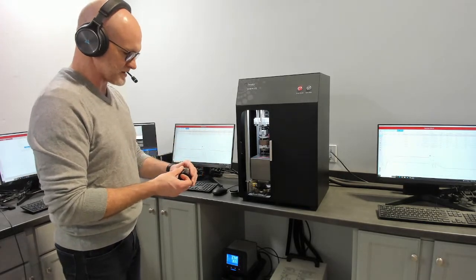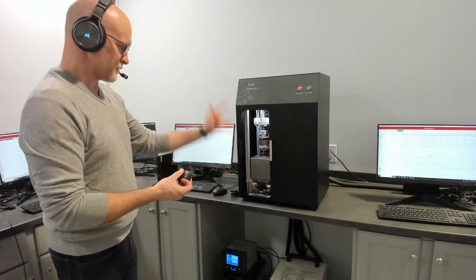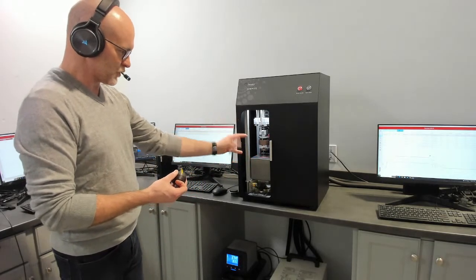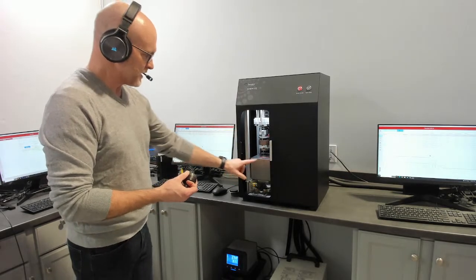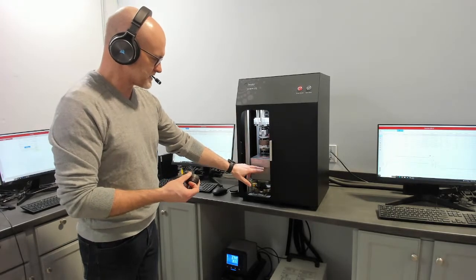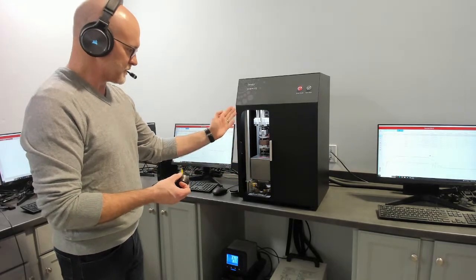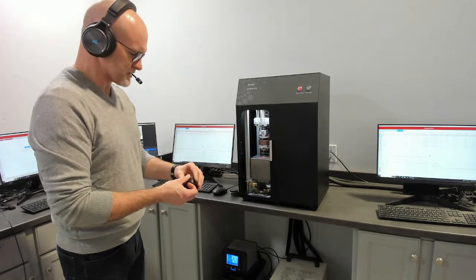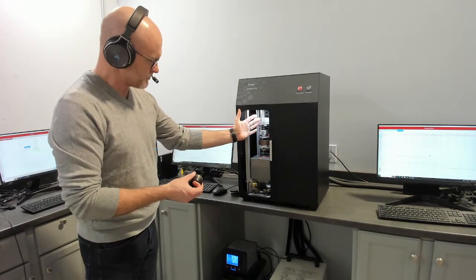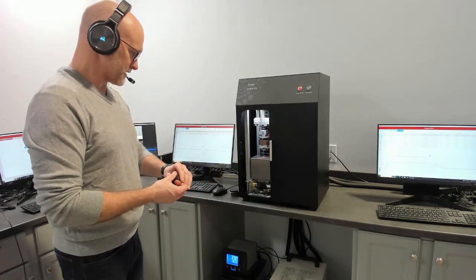When you're measuring resistance, you are forcing a delta T across the sample and looking at one-dimensional heat travel. To facilitate that, these two plates come together at a 20 degree delta, as an example, and the oven comes up. It's all motor controlled. It comes up and is set at the mean temperature between the two plates. That gives you a one-dimensional heat path that's well defined. This measures thermal resistance, and with the measured thickness of the sample from the optical encoder, you calculate thermal conductivity.